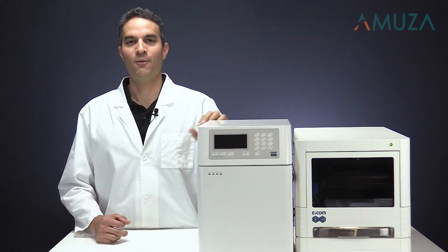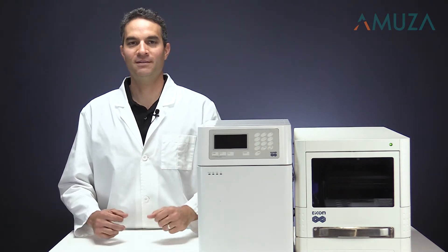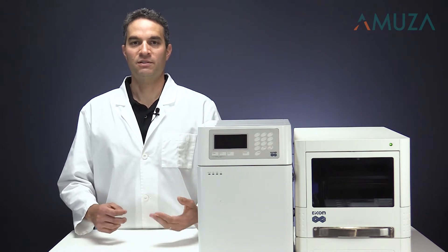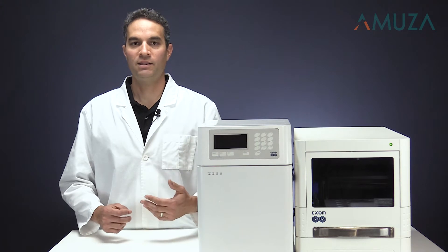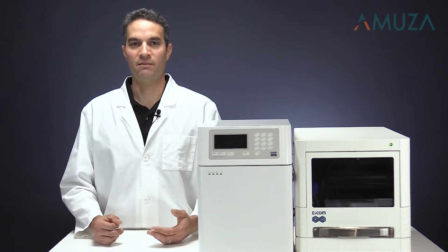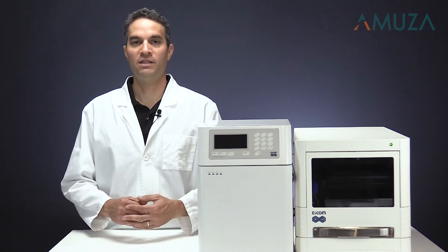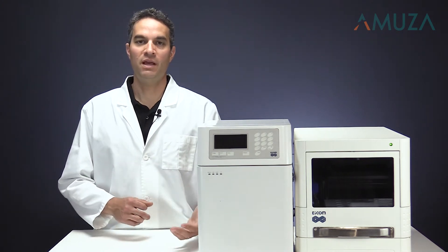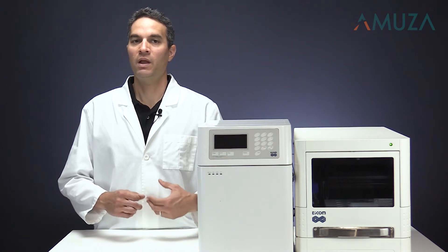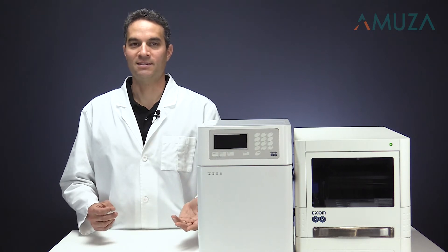But don't let any of that scare you. We've simplified and automated the process to make it easier than ever. Generation of good data and consistent results can take time and resources — that's why many labs require highly trained specialists in HPLC. However, we've developed an application which includes everything you need to run analysis right away: everything from mobile phase, reagent, and column selection. We have everything spelled out for you, so all you have to do is take your sample and start running analysis.